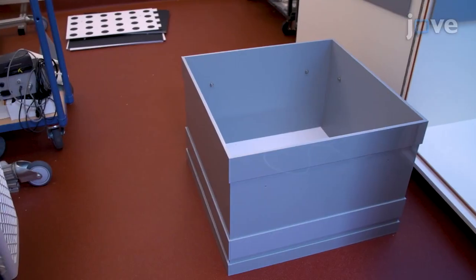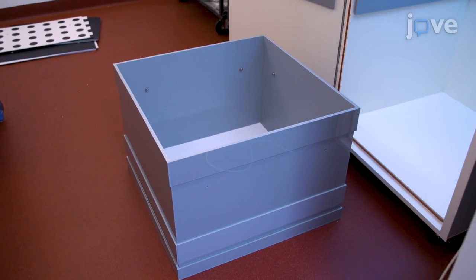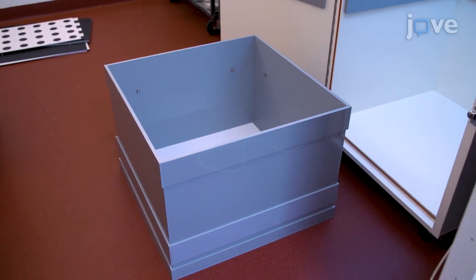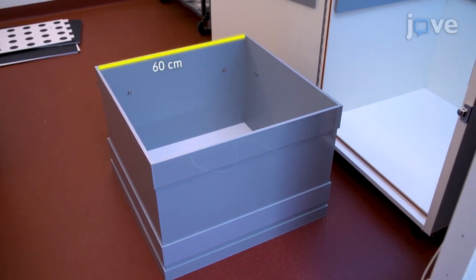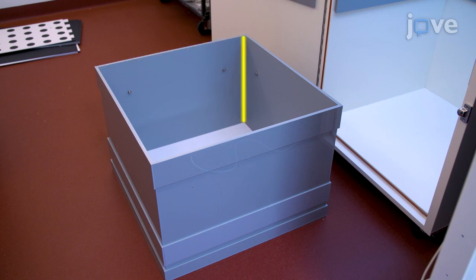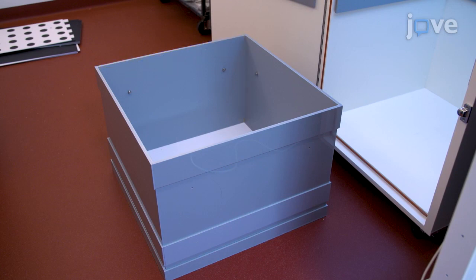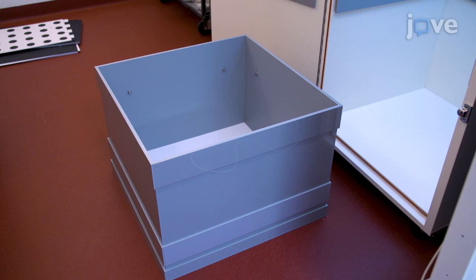To begin, obtain a square arena made of opaque, non-porous hard plastic with a minimum 60 cm width and 50 cm height. For successful recording of rat movements by the automated software, make sure that the floor color contrasts with that of the rat.